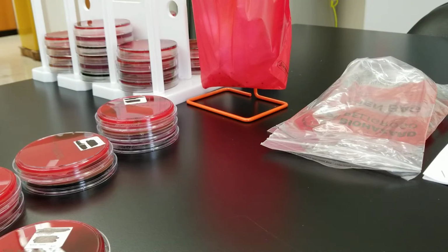Everybody, today we are going to do kind of a video quiz. We've got specimens here, primary setups here to look at and decide whether they're normal flora or if they're a pathogen and we should work them up. Okay, so the first one is a nasal swab.